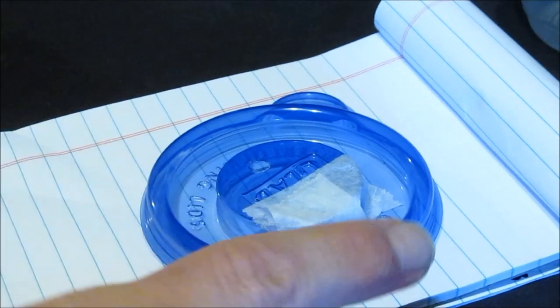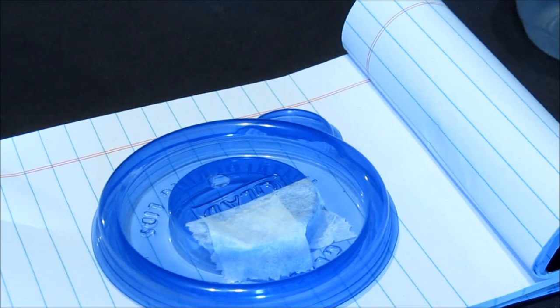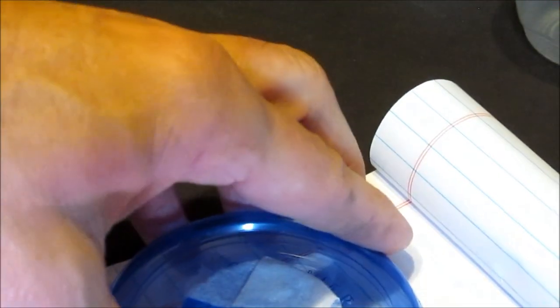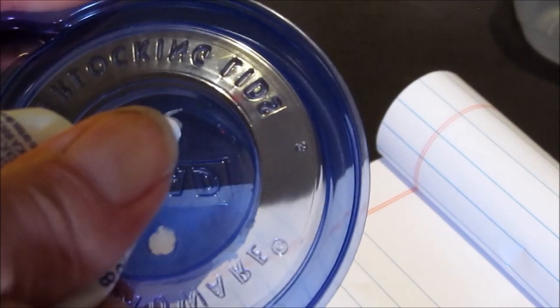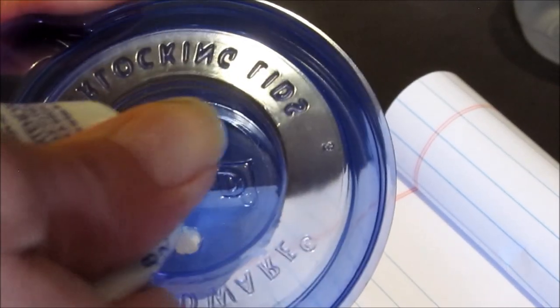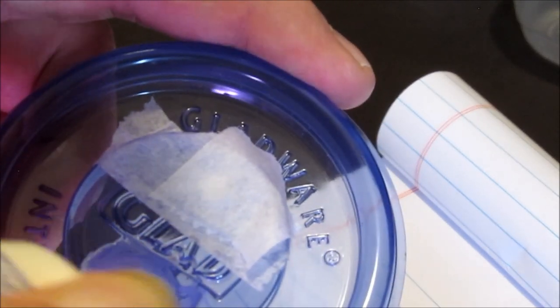Then we're going to have the silicone caulk, which is hopefully still flowing. Now this is the difficult part. We have a hole right here. We're going to start on the back side, push it through, and make your circle like on the filter bag so you leave a good plug for the needle to use. Then you can see how on the top it sticks up, so we're just going to smear that into the one on the top. Bingo, bingo, we're done.